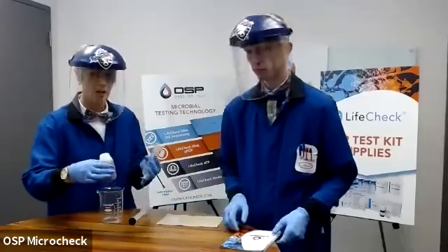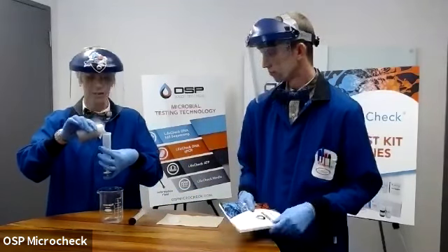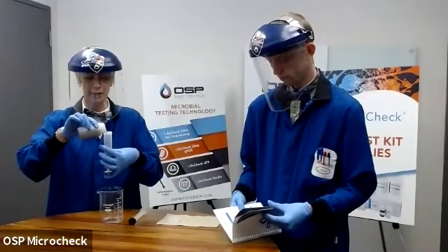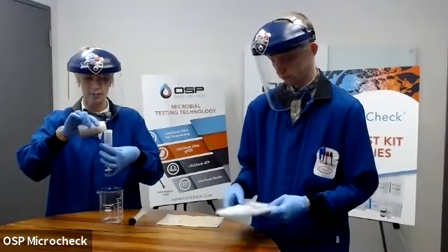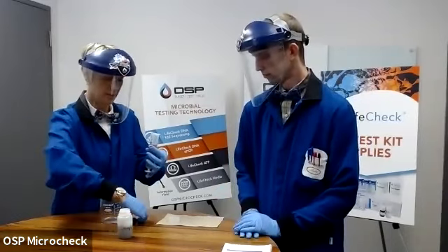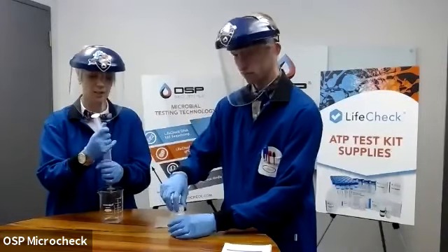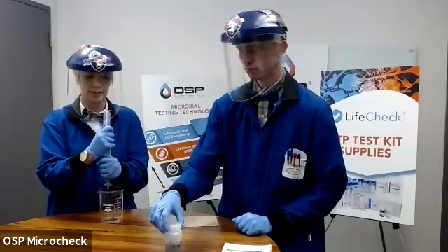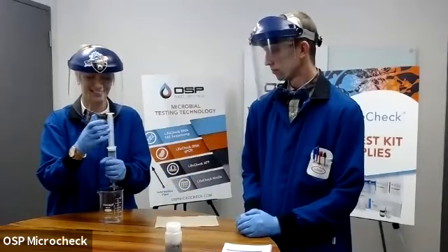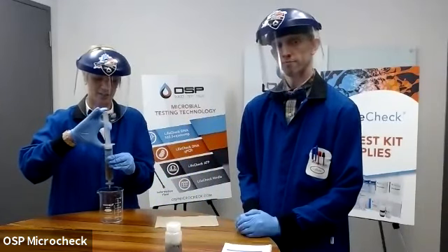Make sure that it's been shaken up as Mark did, and then we pour it in. The more you can filter, the better. So we're going to start and aim for 50 mils, right to that line. I'm going to place my plunger back in, holding it over the waste receptacle. Maybe there's a little bit of a pop. There it is. All right. And then simply push the sample through.